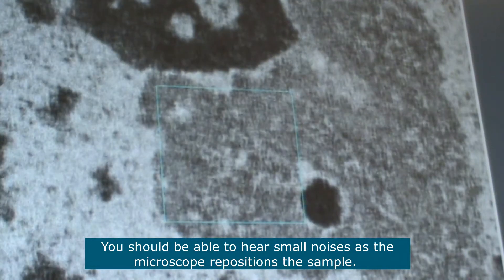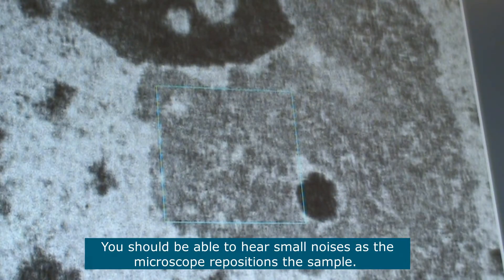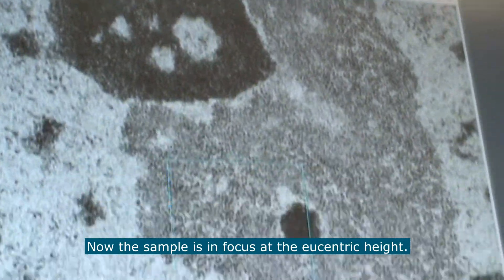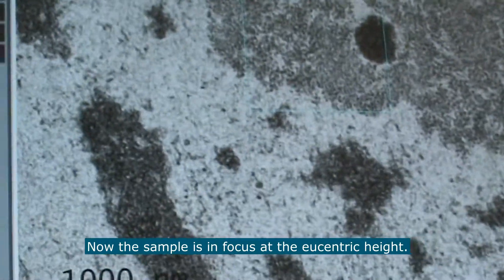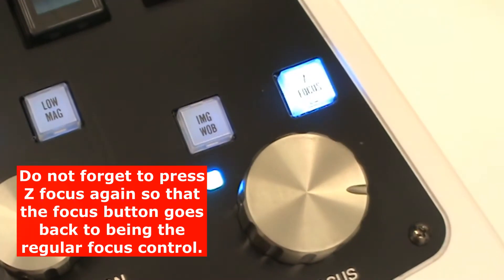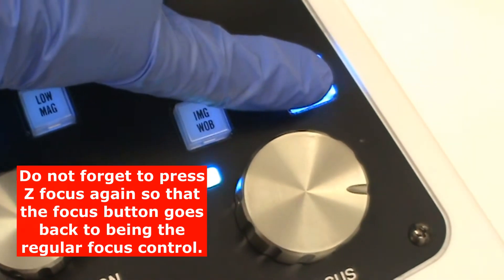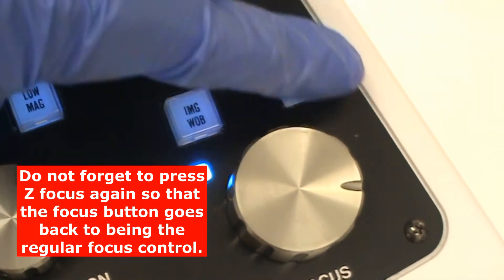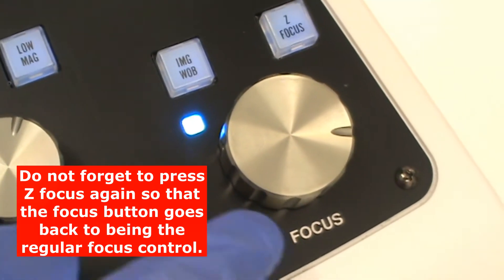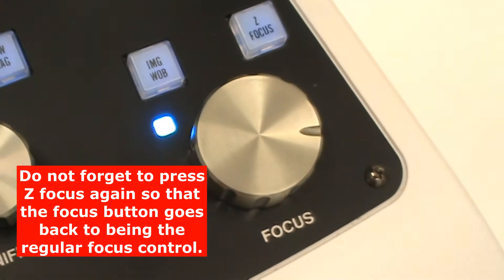You should be able to hear small noises as the stage repositions the sample. Now the sample is in focus at the eucentric height, which means that it is at the real focal plane of the microscope. Do not forget to press z-focus again so that this function is no longer lit up, and the focus button has gone back to being just the normal focus.